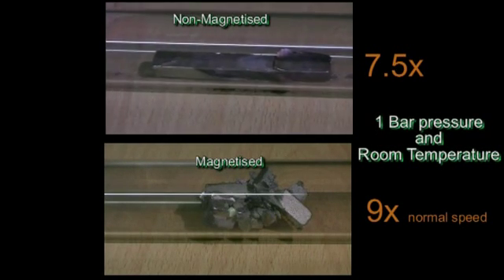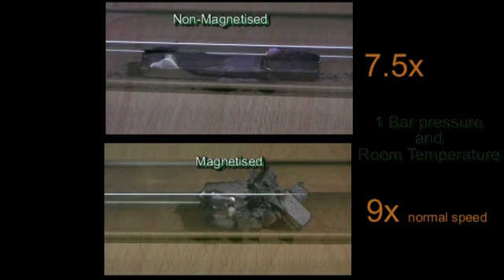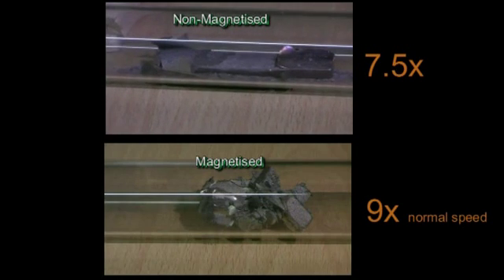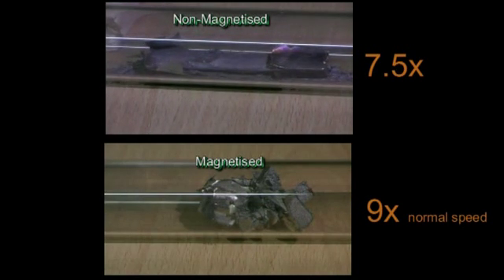The reaction that we can see, which is sped up by the way, is hydrogen interacting with the material. As hydrogen is absorbed by this material, up to a maximum of around half a weight percent.